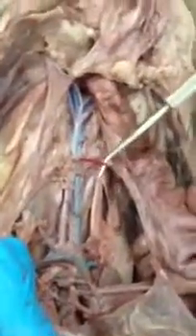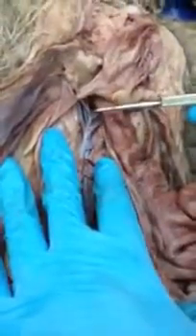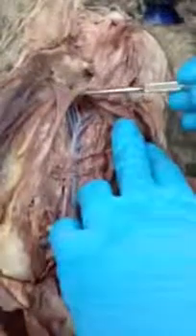As we move farther down the abdominal aorta, we get to another major branch. This would be the inferior mesenteric artery. And then we get to the branch point here where we can see the common iliac arteries. And then we would have internal iliac arteries and external iliac arteries, and the externals would feed in as the femoral arteries. If we look at the venous system, what you're looking at here is the inferior vena cava.